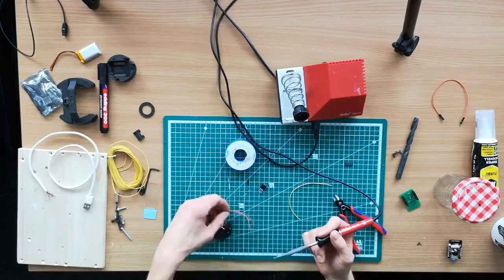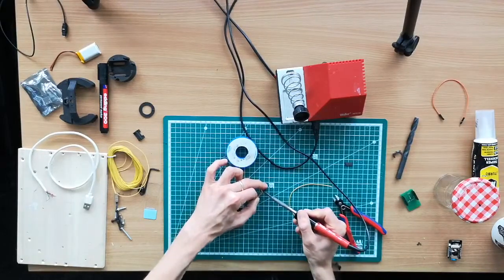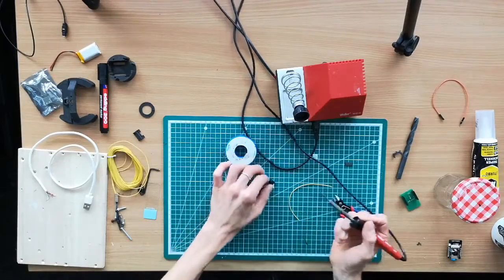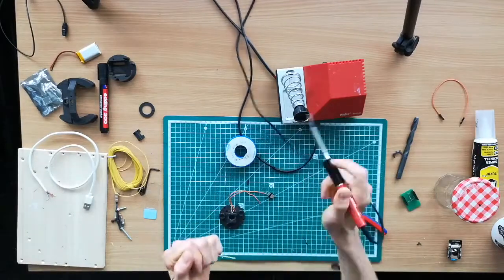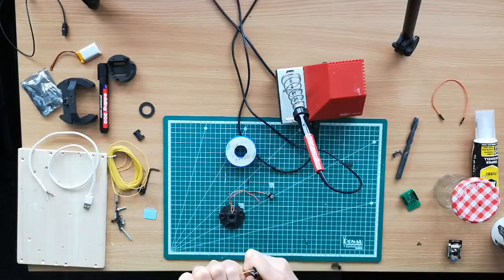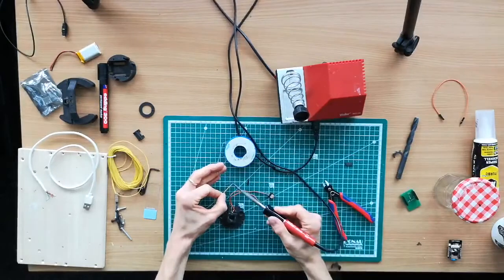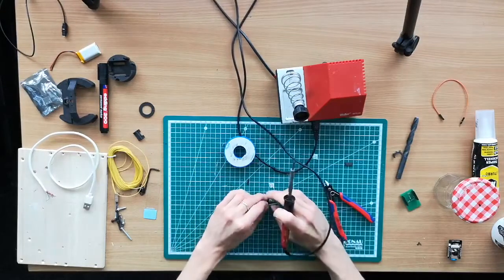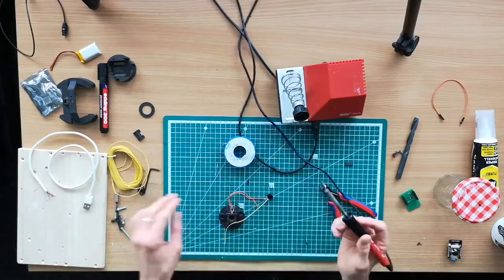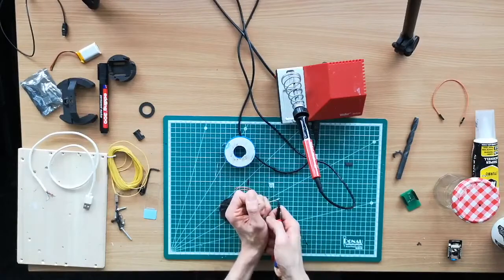And then we hook up one of the wires to the 5 volts, the other one to the collector, and then the emitter goes to ground. That's how we use the transistor here. And the transistor essentially just switches the pulse width modulated output of the ESP. So here we remove the insulation, add some lead, and then we also add that to the transistor. And it can be any transistor, since the current is not so large. So this here goes to ground, but I also showed you in a sketch.